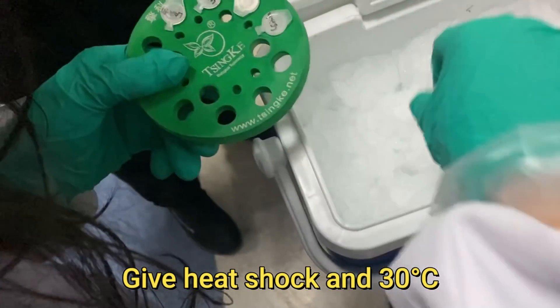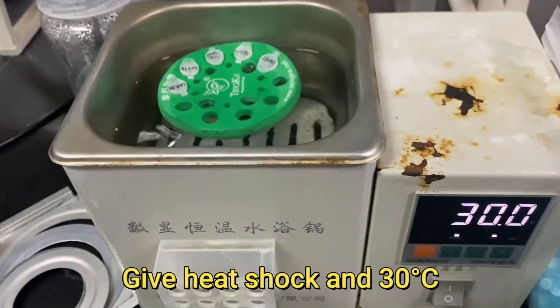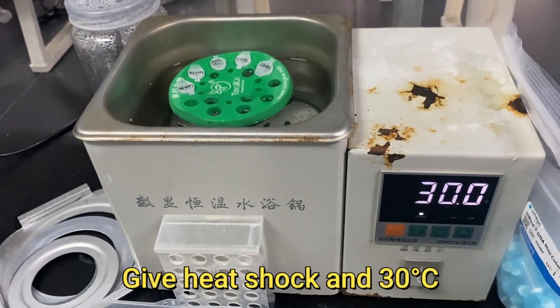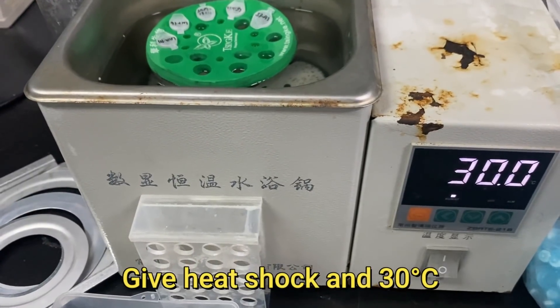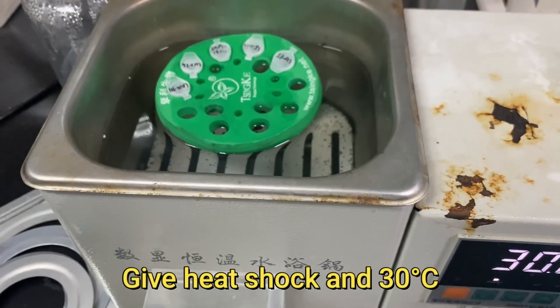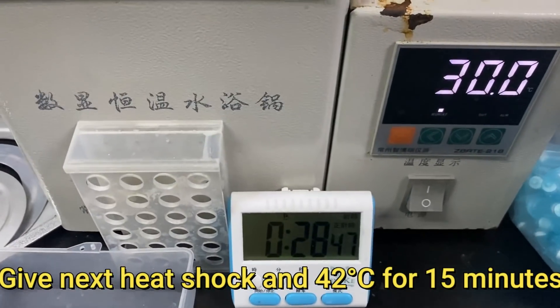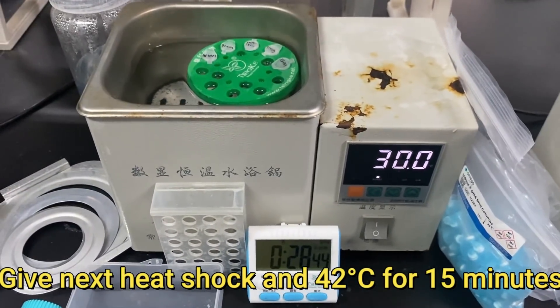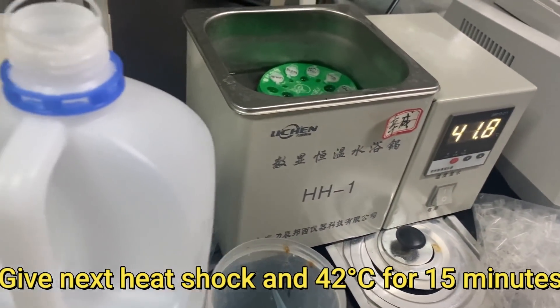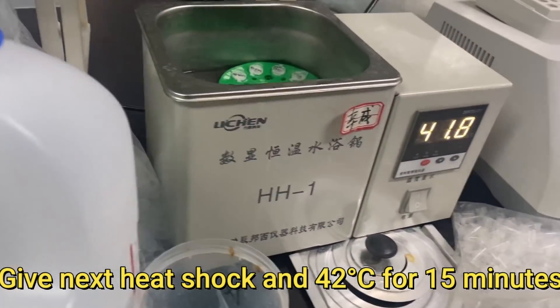Now Y2H samples are ready for consecutive two heat shocks — fifteen minutes at 42 degrees Celsius.